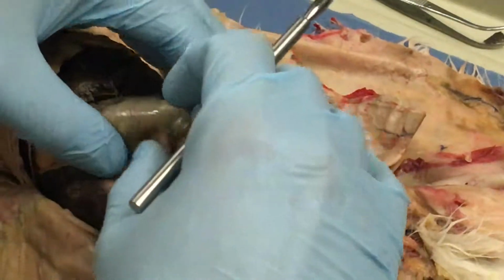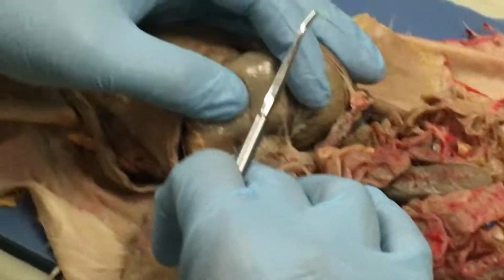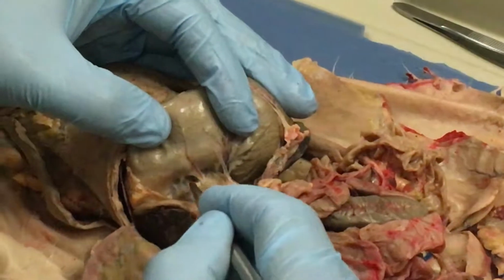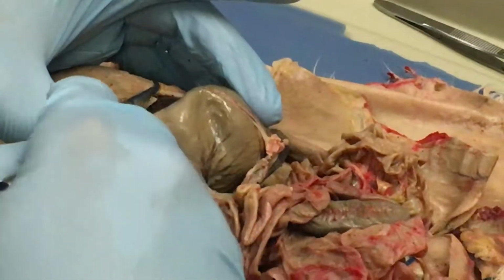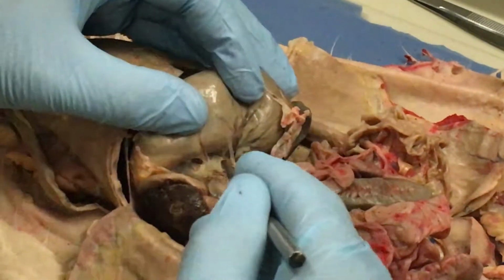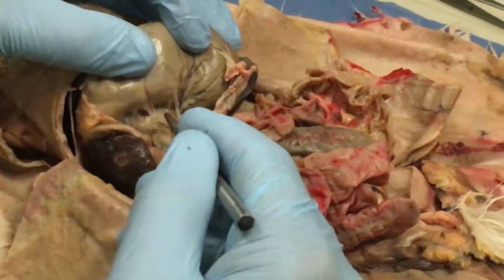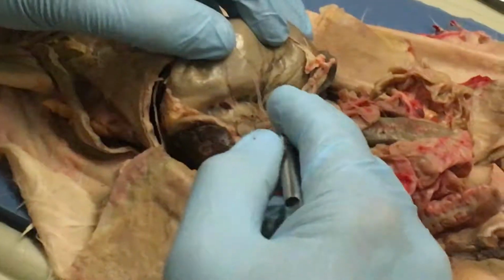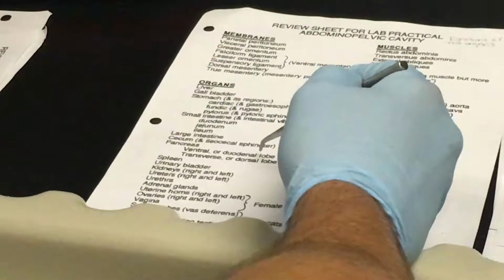Pancreas. Now here's another difference between the cats and the rabbits. Okay, the pancreas is just this mess in here. It's just this tissue that's kind of in this mesentery right here. It's not like a solid organ like we would expect, like the liver or the spleen. It's just this tissue that's in this mesentery. Now it's a little bit different in a cat. But for you guys who haven't seen the cat, this is your pancreas right here. So you don't need to worry about these lobes of the pancreas. That was all about the cat.